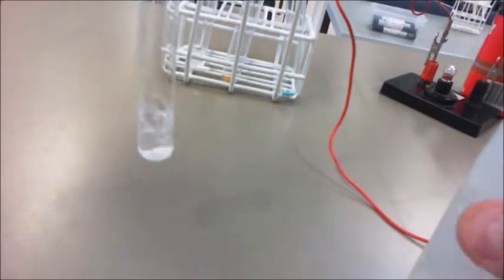Let's go with calcium now. Okay, and calcium has this white powder that's at the bottom. Again, we add a little bit of water to that, and let's just get that working. Okay. Doesn't appear to dissolve too much in there, and again produces pretty much a white or a clear liquid.